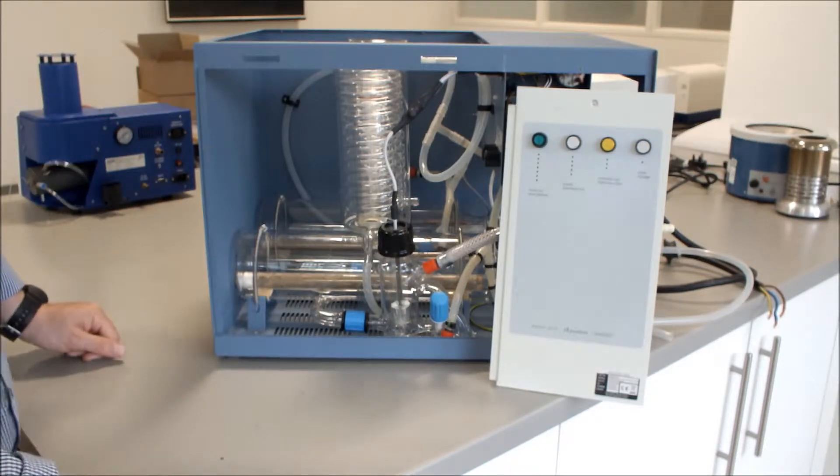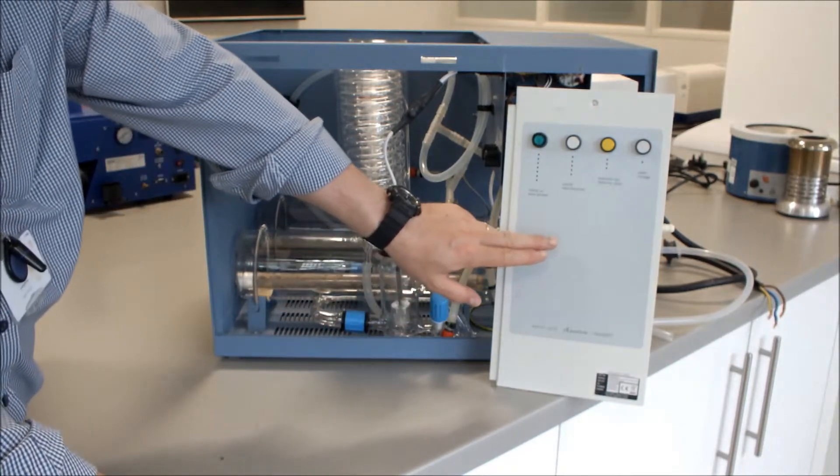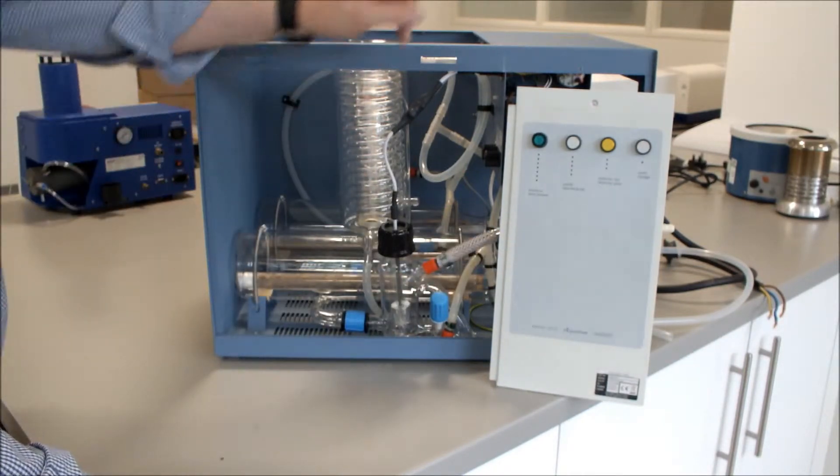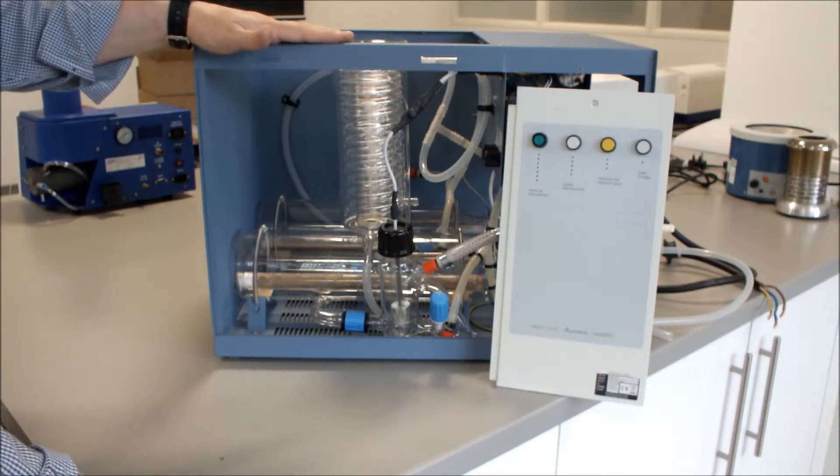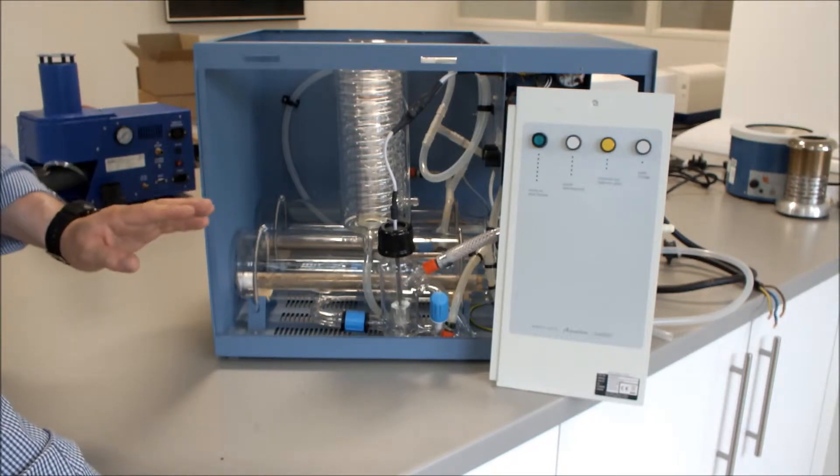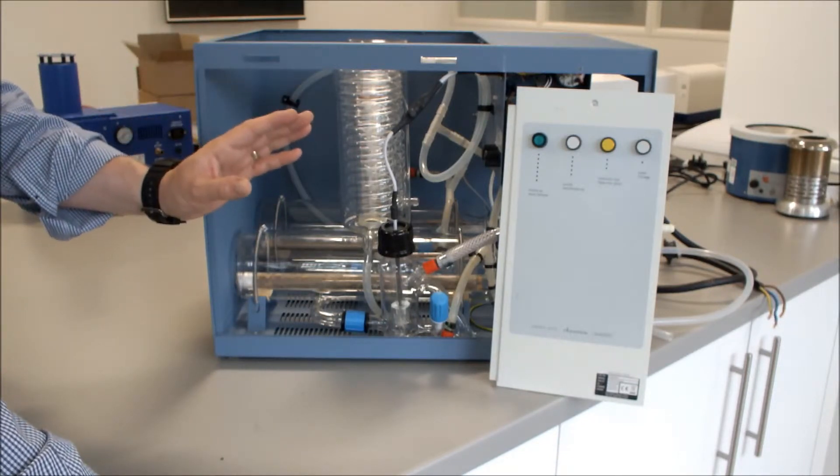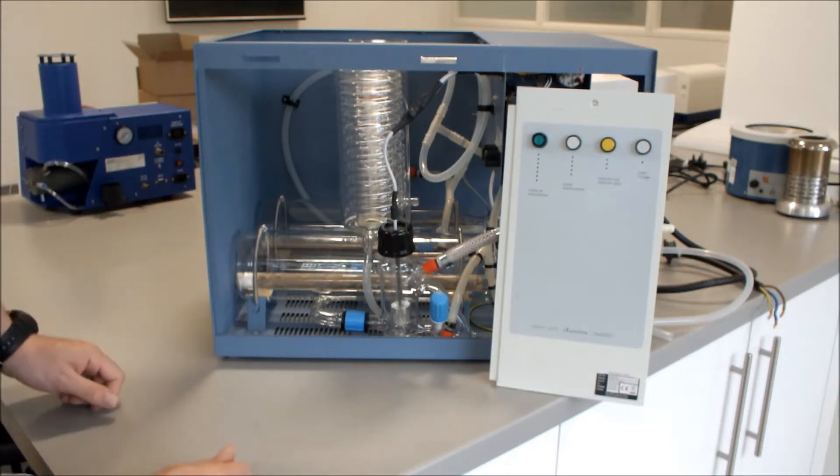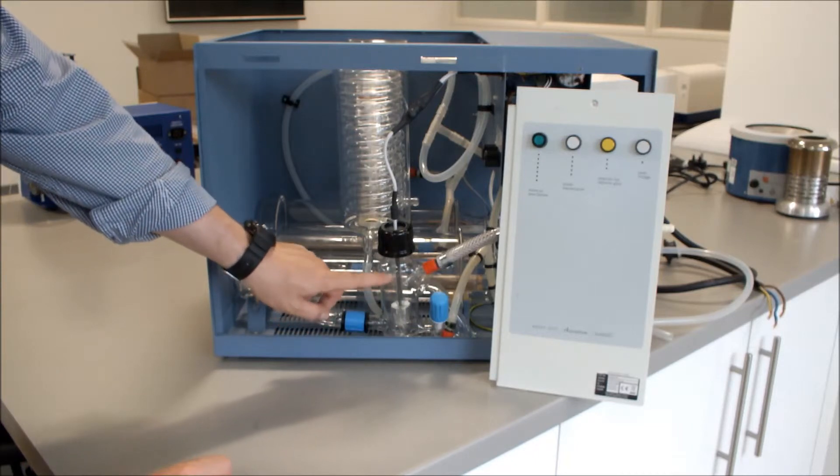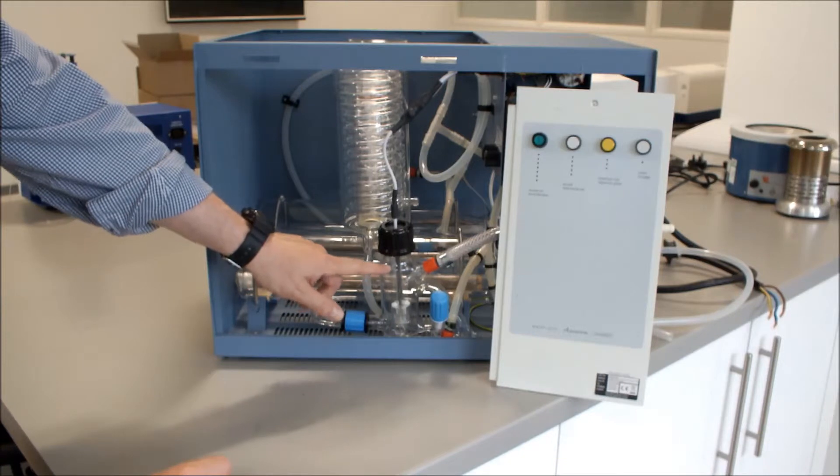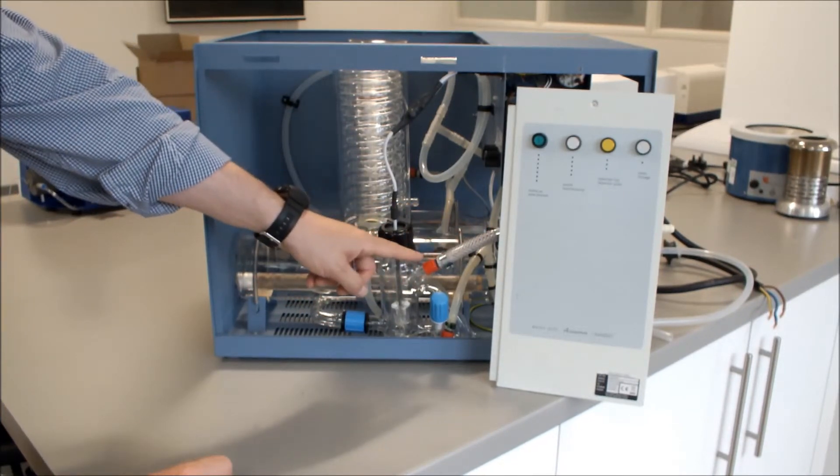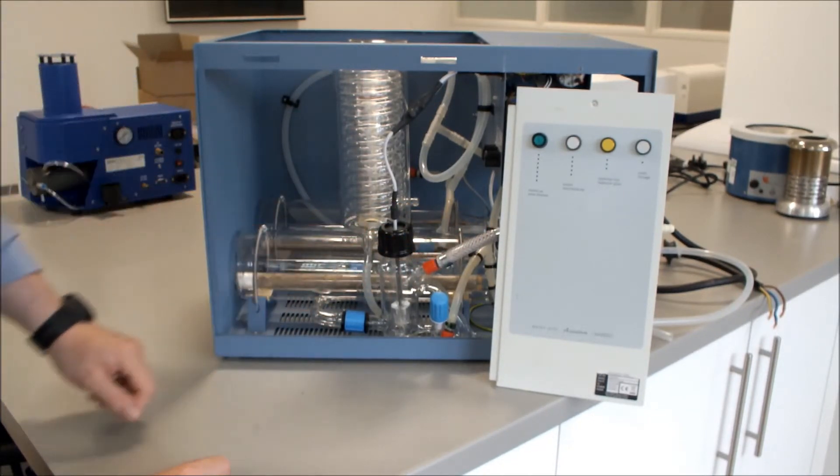The water conversion kit is now fitted to the unit. The next thing to do is to fit the switch panel, fit the side panel, and fit the lid. When you've fitted them, you can then connect up your electrics, connect up your water, and operate your unit using the deionised water. Check for any leaks inside there, and also check that the float switch assembly in the front boiler level control actually switches on and off the deionised or pre-treated water coming into it.